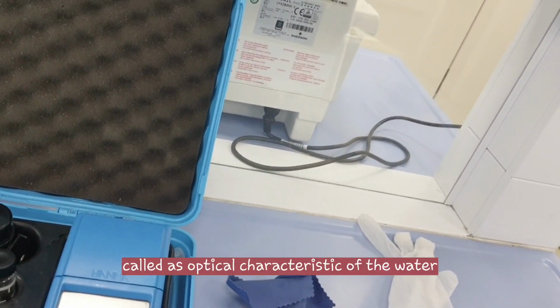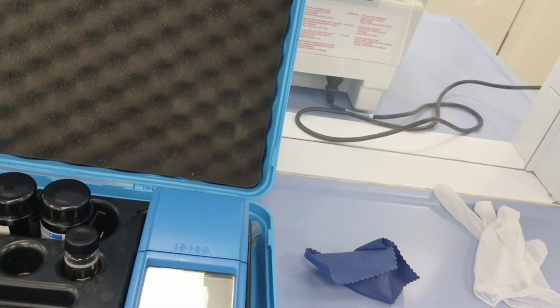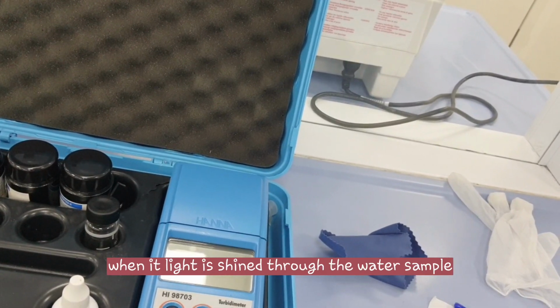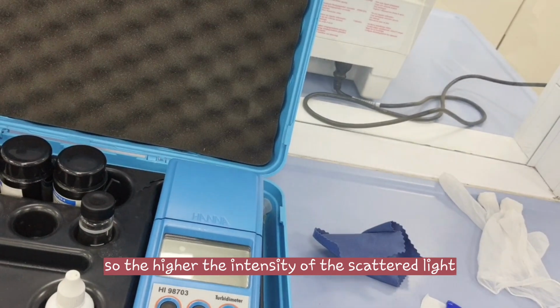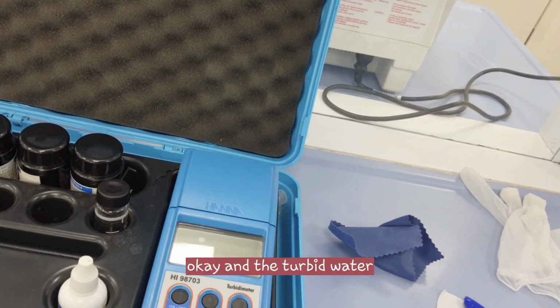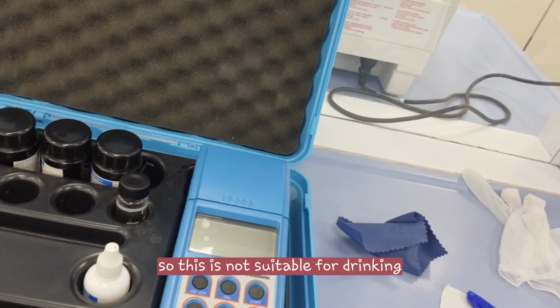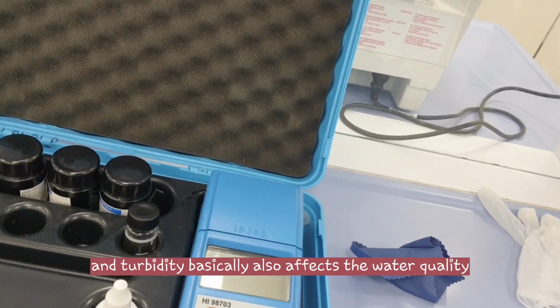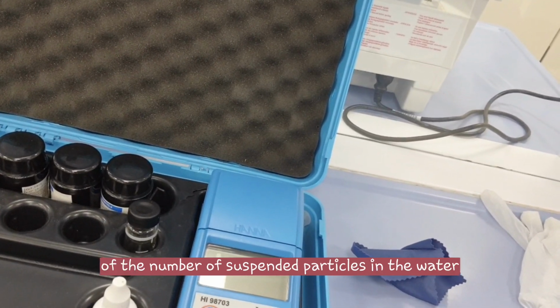Turbidity is also defined as the relative clarity of a liquid, and it is also called an optical characteristic of the water. It is a measurement of the amount of light that is scattered by the material in the water when a light is shined through the water sample. So the higher the intensity of the scattered light, the higher the turbidity. If the water has a high turbidity, more than 5 NTU, it is not suitable for drinking, and turbidity also affects water quality. It is an important indicator of the number of suspended particles in the water.